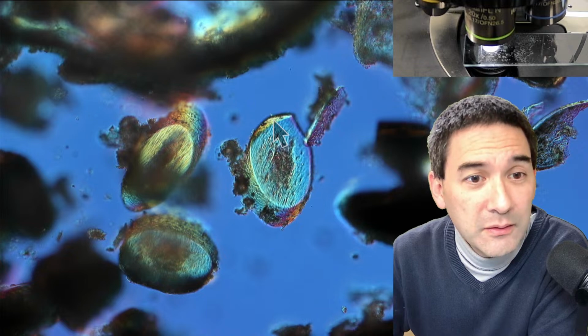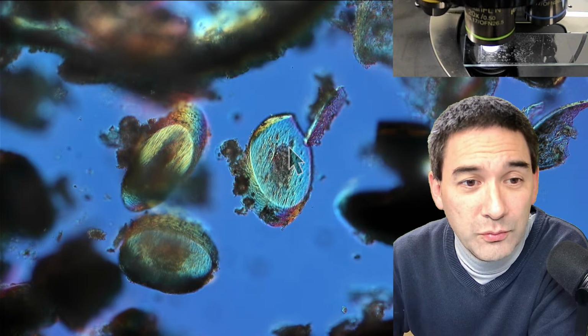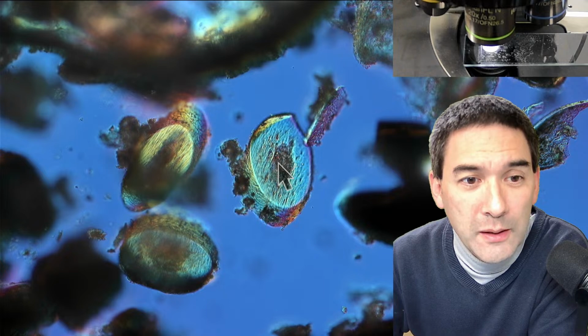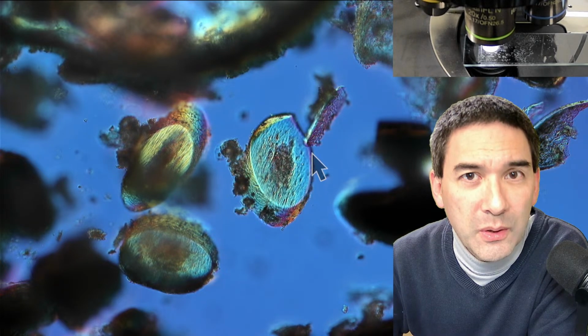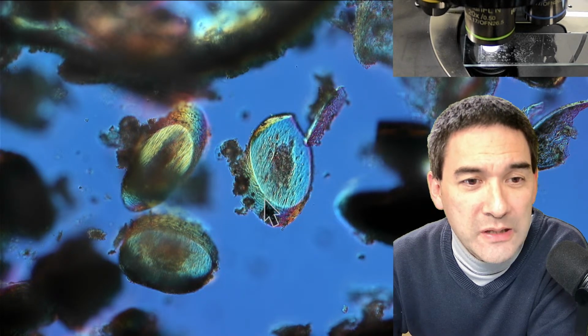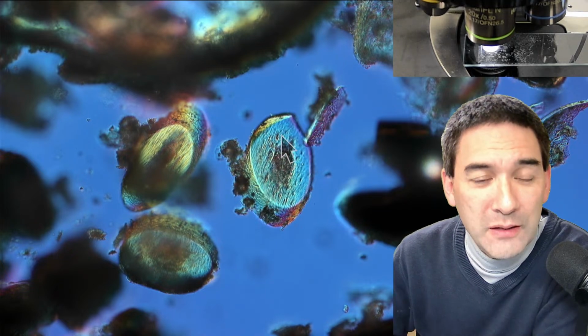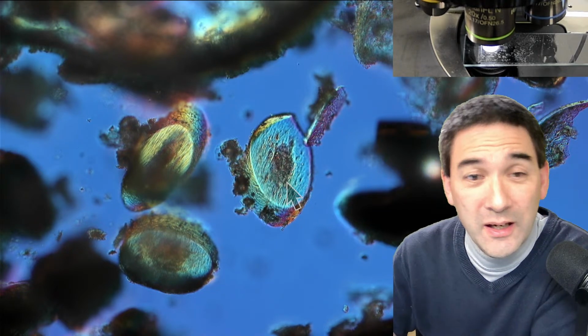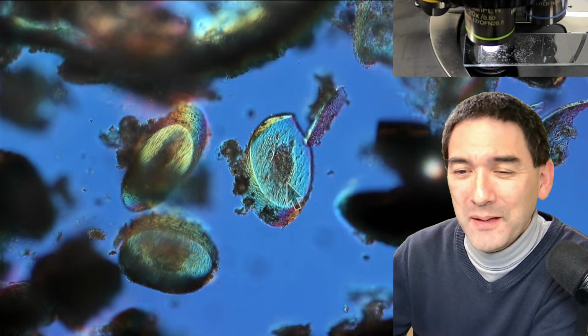So we're able to see how hair looks on the inside. What you can see here is that the hair in the inside has a region that's a little bit different. It's called the medulla. You see the different layers, and that's called the cortex. There's also the so-called cuticle on the outside, the outermost layer. Of course, if you take a hair and put it directly under the microscope, you're never able to see it in a cross section like this. So I like this perspective as well.